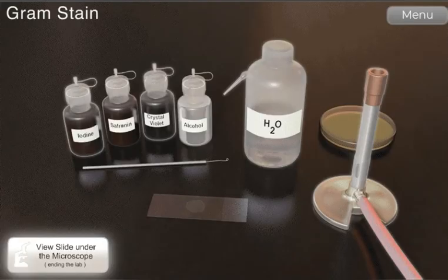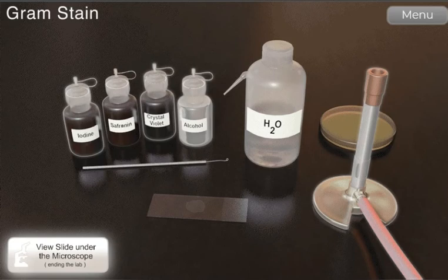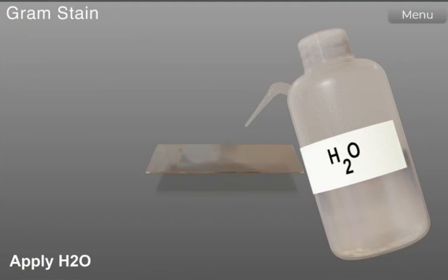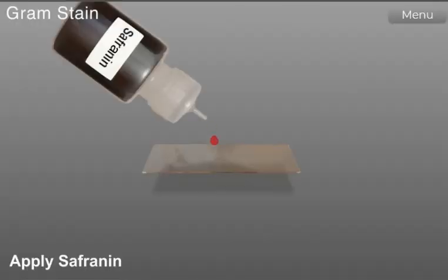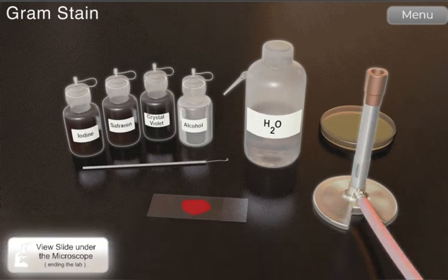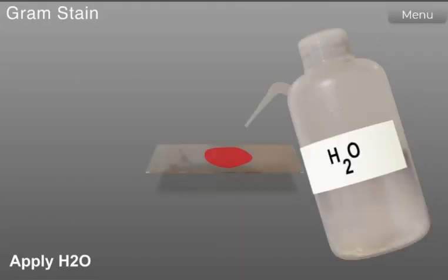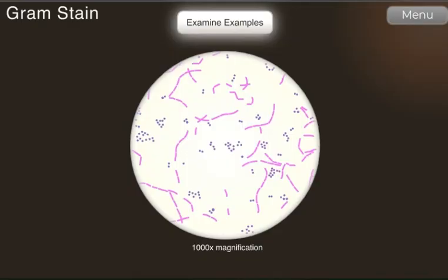Decolorize with alcohol for 5 until 10 seconds. And then rinse with water. Next, flood the slide with safranin for 1 minute. And then wash the slide using water. Next, view slide under the microscope. This is the result.